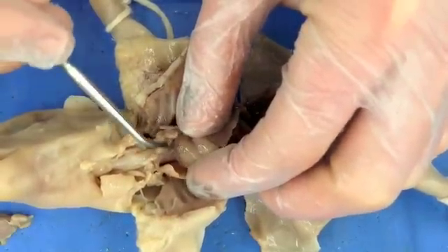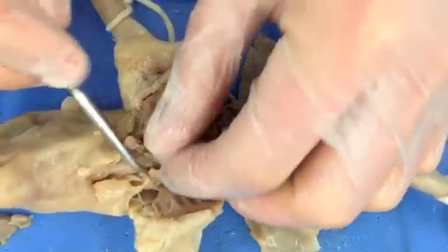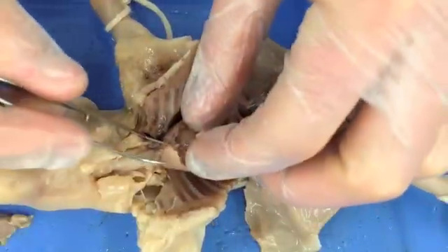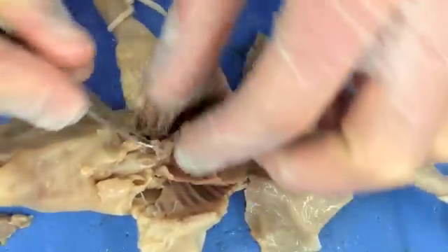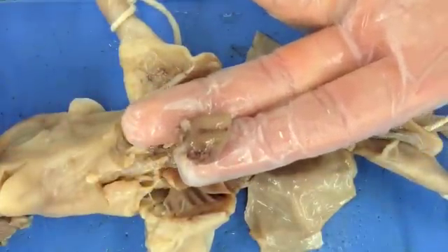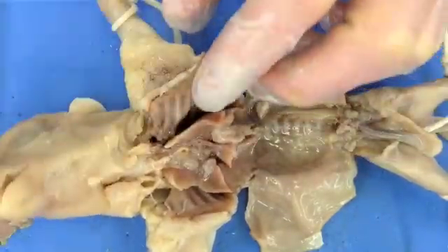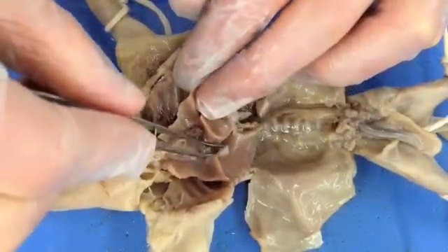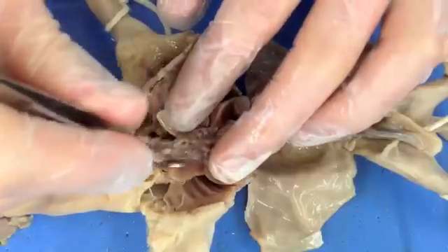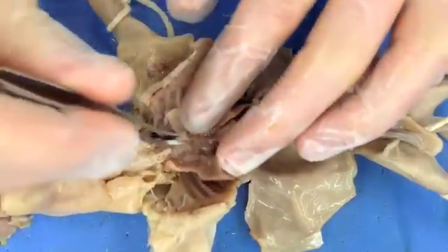So we tease this back a little bit, kind of removing the sac that's around the heart. Using some tweezers here to remove it. Here's the heart — or the pig's heart. We'll put that to the side. And then below it are your lungs. They come in multiple lobes, and you have your right lung and your left lung. I'm going to try now to dissect this out just a little bit and see if we can expose the bronchial tubes.